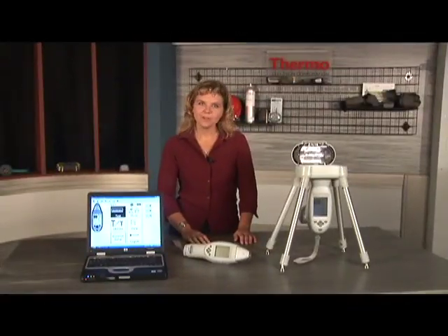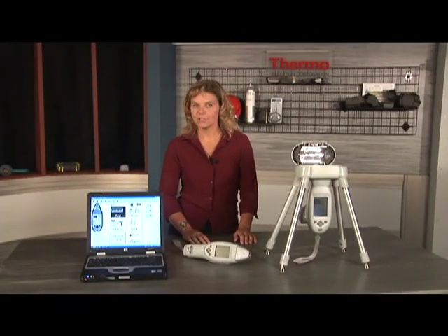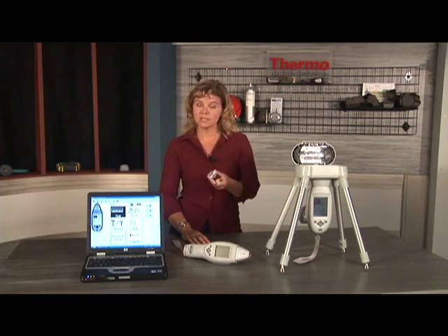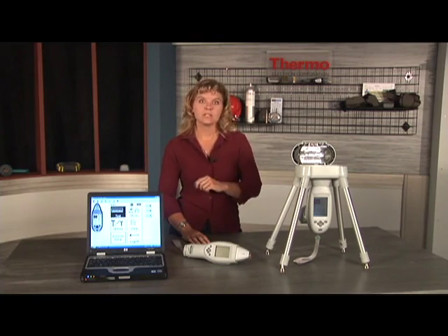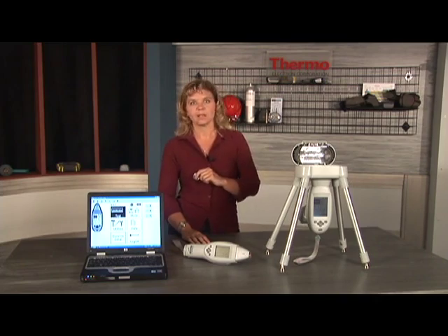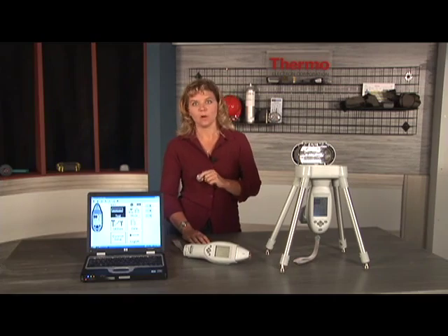Let's begin with a typical alloy sample that might be checked by the QC department at the producer of stainless steels. One of the most popular stainless steels in the world is this grade 316, an austenitic stainless, also known as a chromium nickel stainless steel. We will look at the results as if it were an unknown, but later we'll compare the measured results to the certified values. This will help to demonstrate that your portable Niton Analyzer is capable of providing lab quality accuracy for alloys.